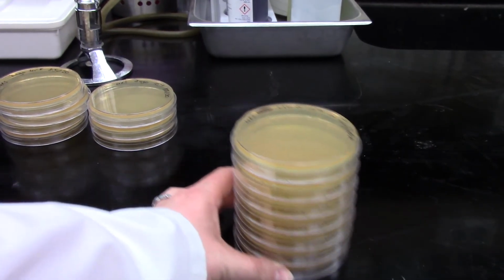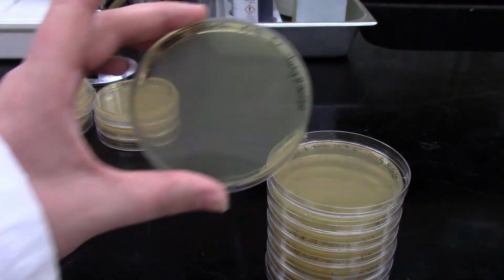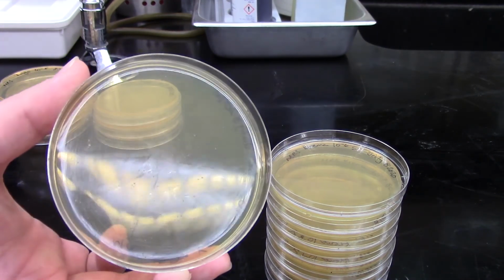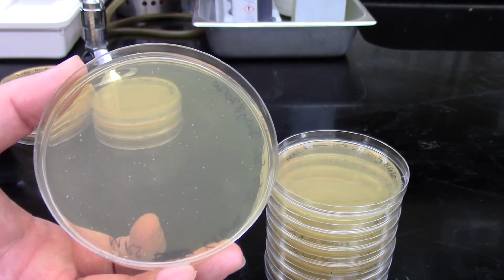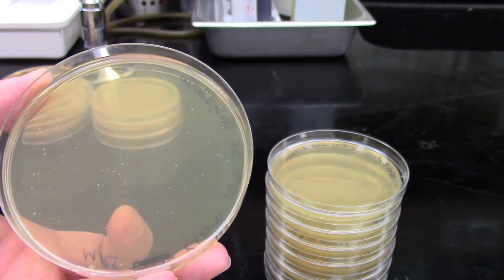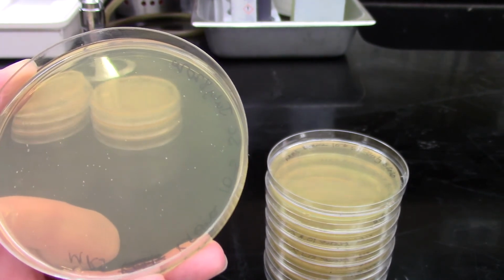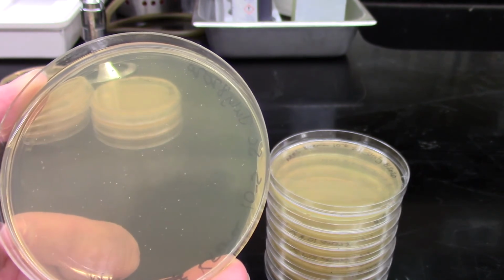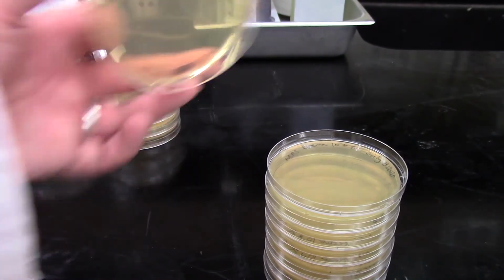And then if we look at our crema, so that was our Greek yogurt sample, we can see on the 10 to the minus 5, let's just see if you can actually see that well. There we go. So we have a decent number of colonies on there. It looks like this one will probably be a countable plate. So for this one, we could have actually plated that previous dilution, and we may have seen decent growth from that. It probably would have been too numerous to count though. So this will be a plate that we get some data off of.